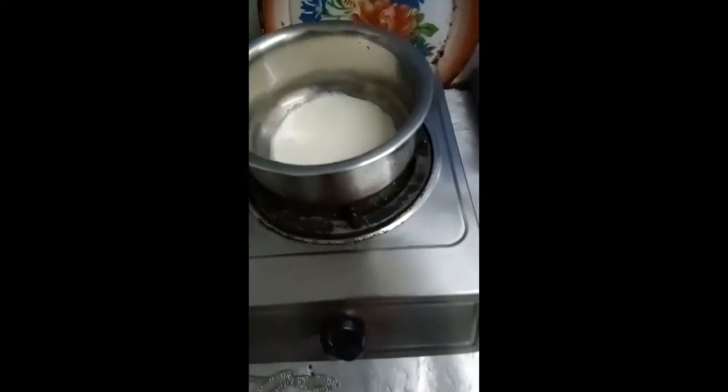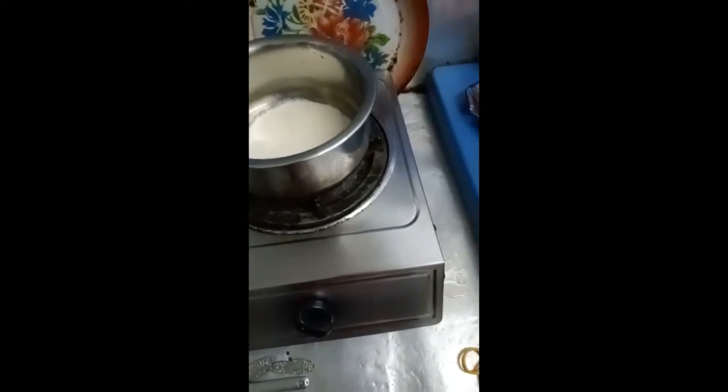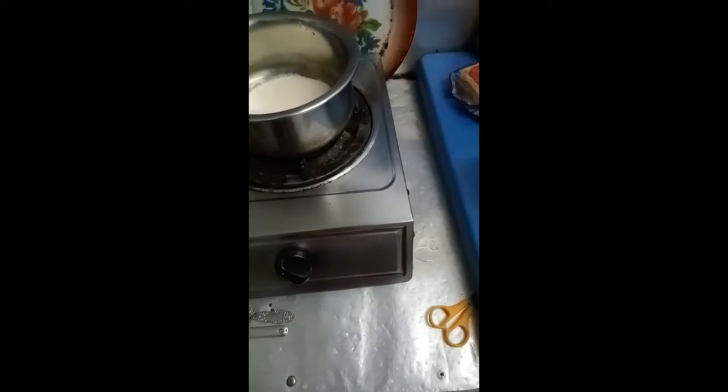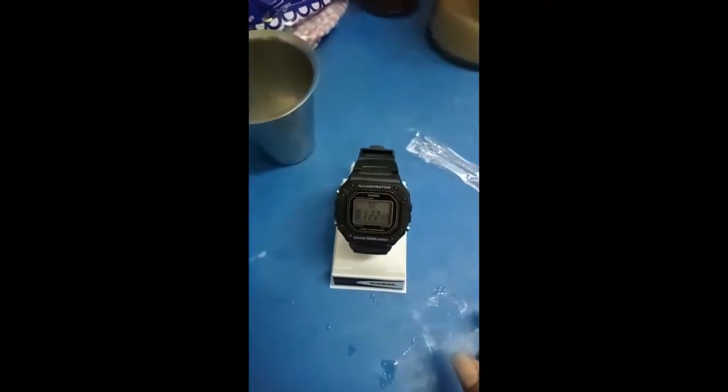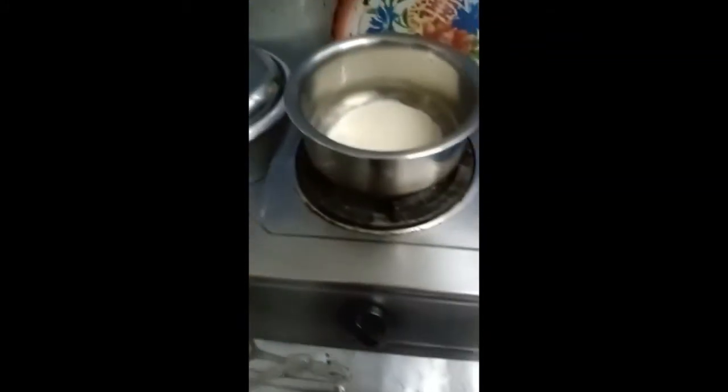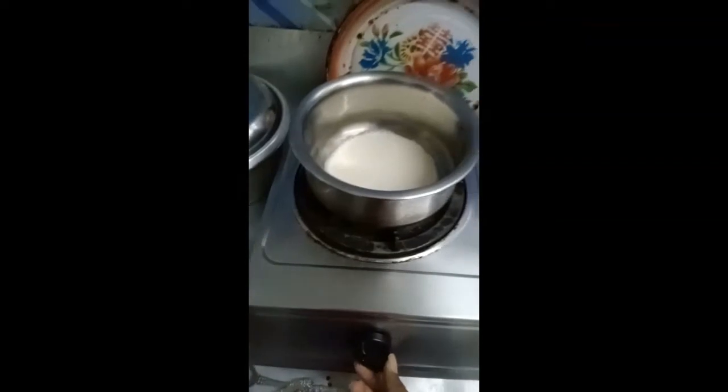During heating of the milk, the timer is important. I kept track of the time here with the watch. I stopped the stove at 2 minutes 10 seconds when the temperature is about 60 degrees Celsius. The heated milk, showing some mild steam, is about 60 degrees Celsius.